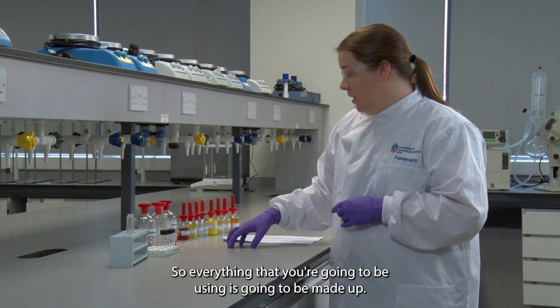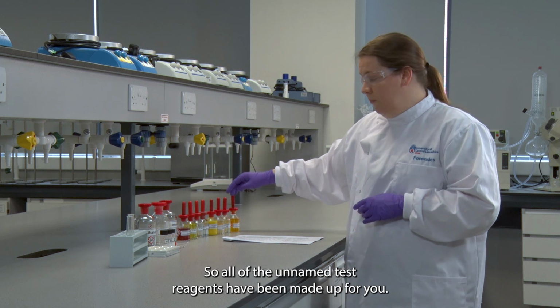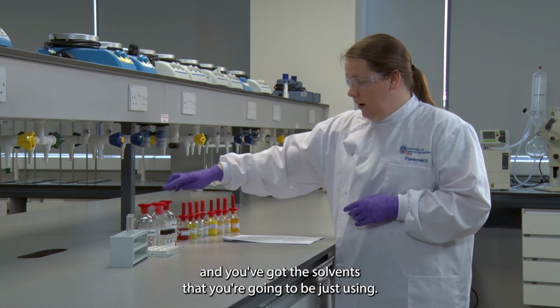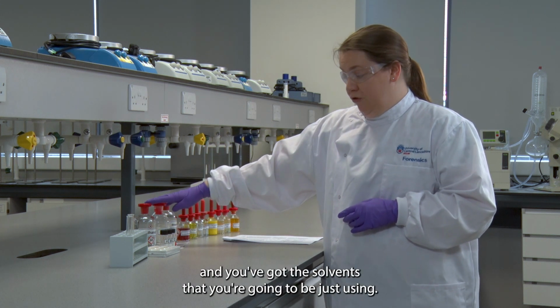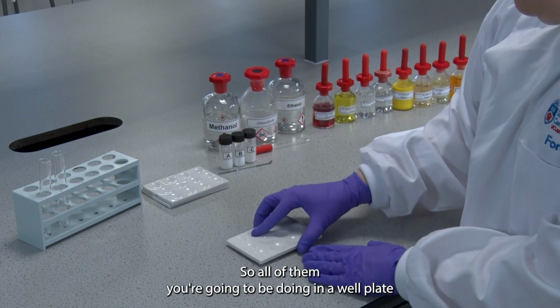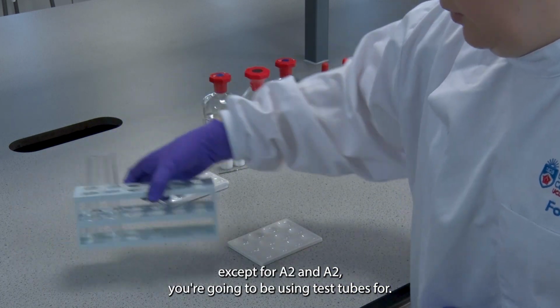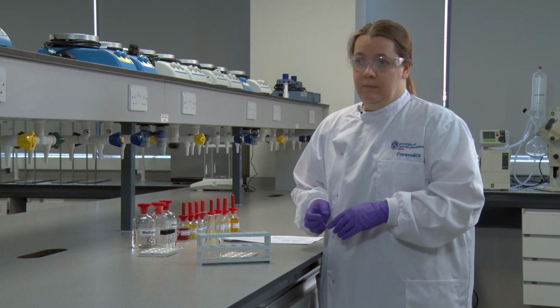So everything that you're going to be using is going to be made up. All of the unknown test reagents have been made up for you. You're just using them, and you've got the solvents that you're going to be using. All of them you're going to be doing in a well plate, except for A2, and for A2 you're going to be using test tubes.